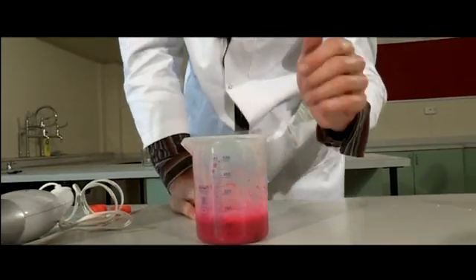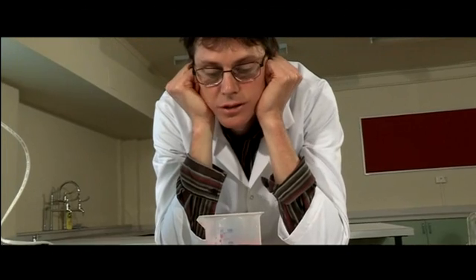Just gently agitate it. You want to avoid the froth, and then we wait for about five minutes.